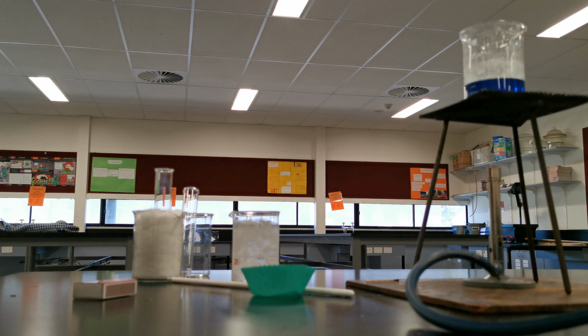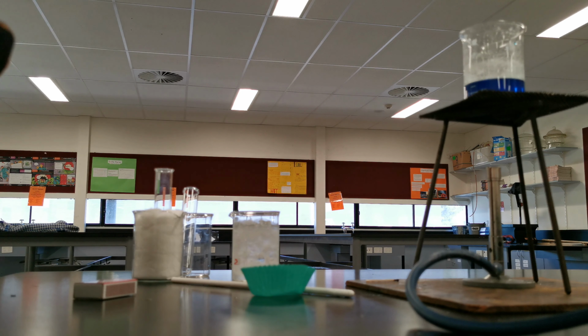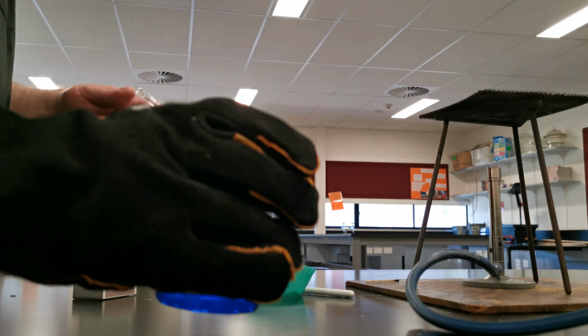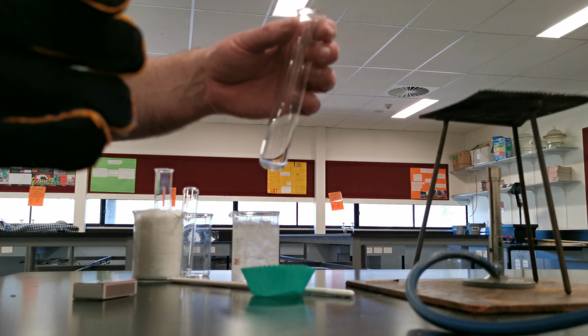Now, that beaker of copper sulfate has just been boiled. It's very hot. I don't want to touch it with my fingers because lab rule 101, hot glass looks like cold glass. You think, oh, there's some glass, I'll pick it up, burn yourself, you break it, not so good. So I have this massive big glove here, so I can actually just pick it up. What I want to do is divvy up this copper(II) sulfate solution into 3 test tubes.